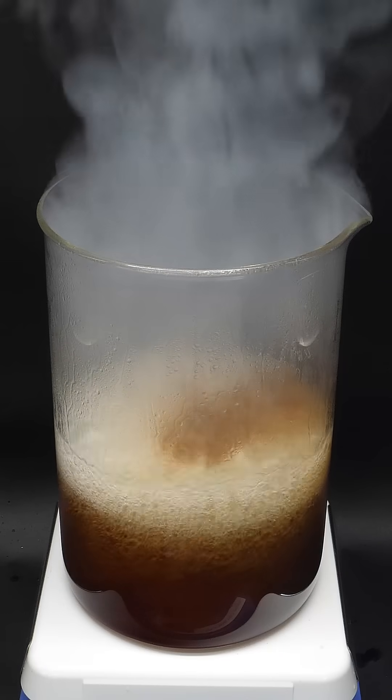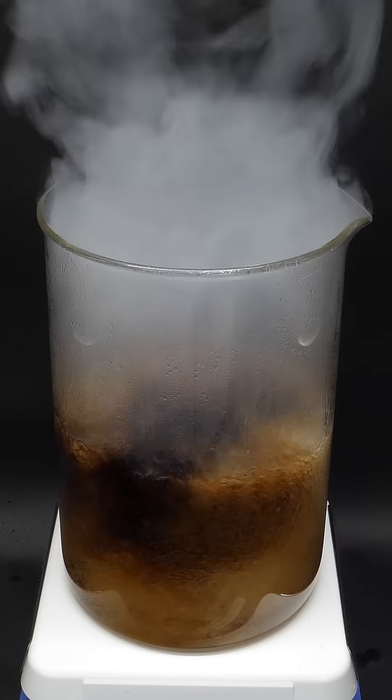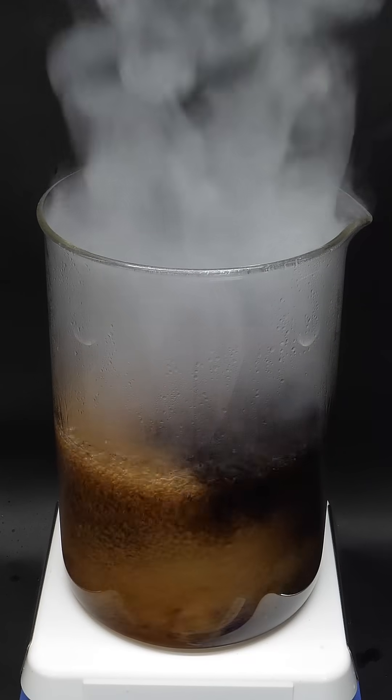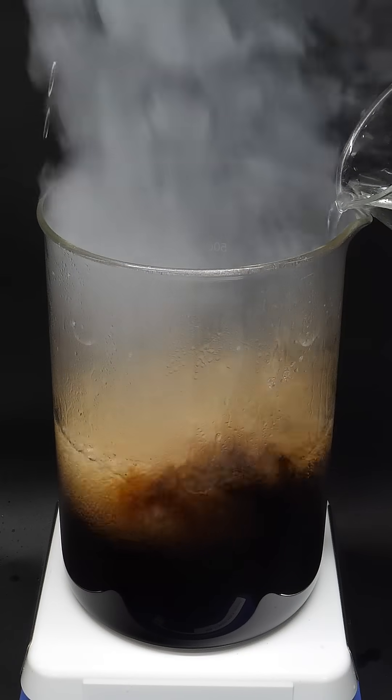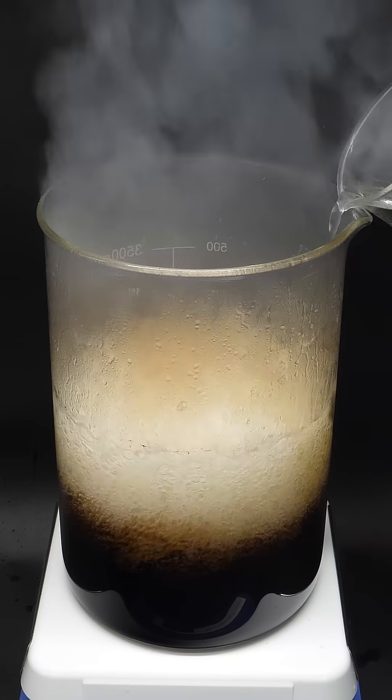I think it's pretty obvious, but I'm still going to mention that this is extremely dangerous. If any of this splashed on me, it would do something very similar, which wouldn't be super pleasant.